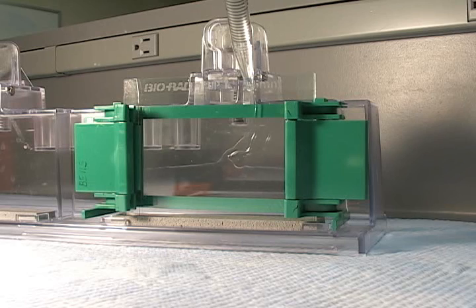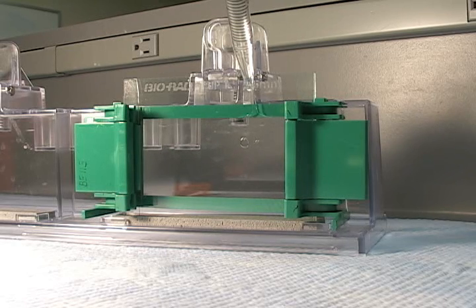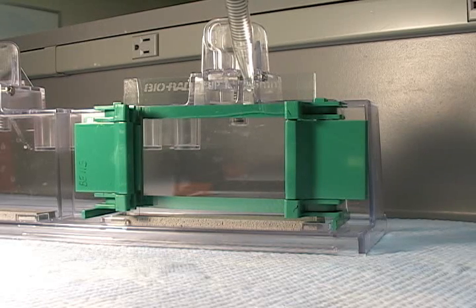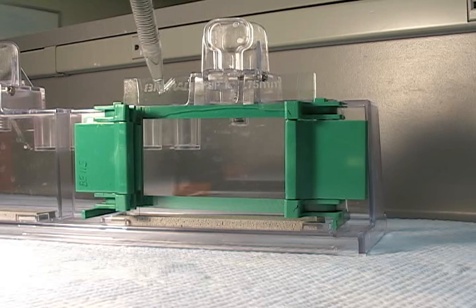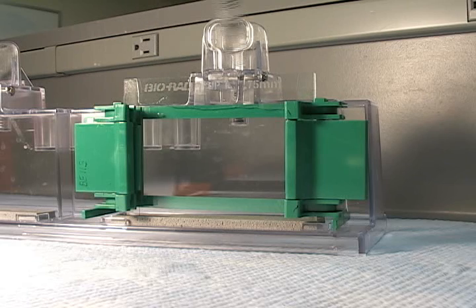I want to avoid bubbles as much as possible, though those will be eliminated mostly in the next step. My goal here is to load this up to the middle of that green bar, which is appropriate for this gel and concentration.